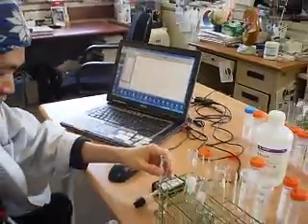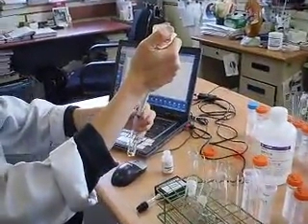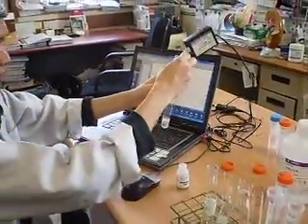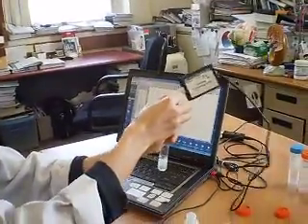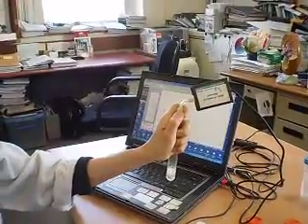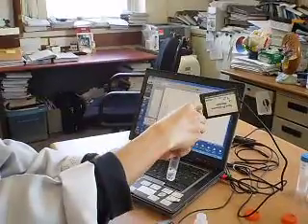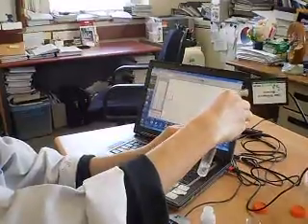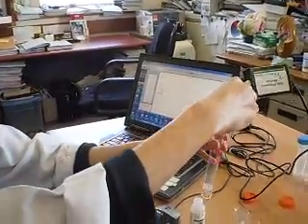So it's my hydrogen peroxide. Once I add it in, pressure starts to increase over time. I will collect and measure for the first 15 seconds. This is what I will do. So I'll run it for 1.5% and then at a lower concentration.